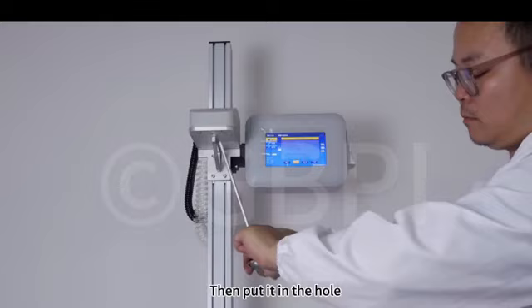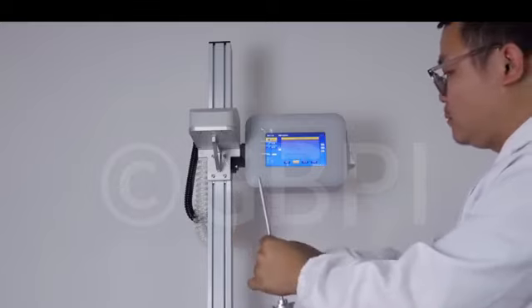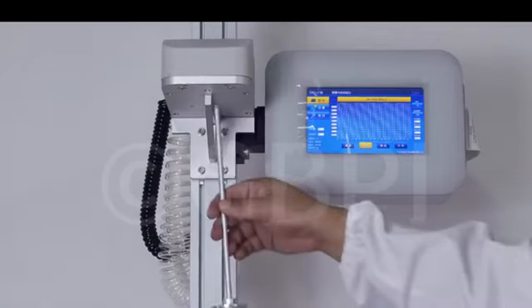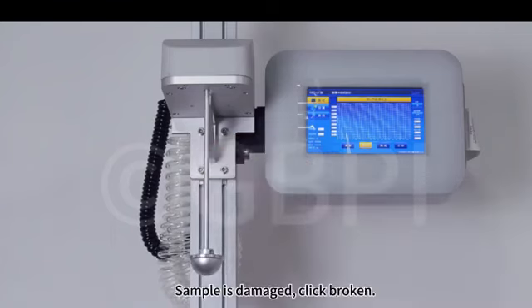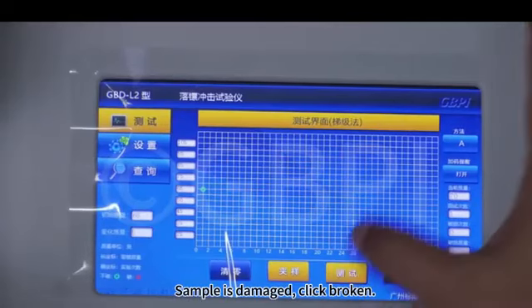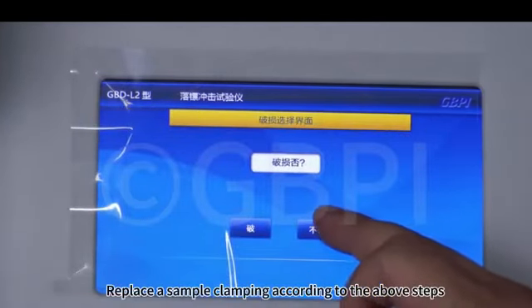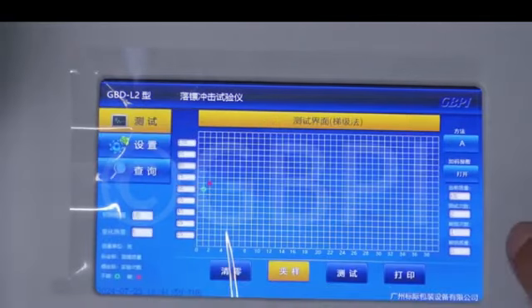Then put it in the hole. It will clamp automatically. When ready, click Test on the screen. If the sample is damaged, click Broken. Replace a sample clamping according to the above steps. Then keep changing samples for testing.